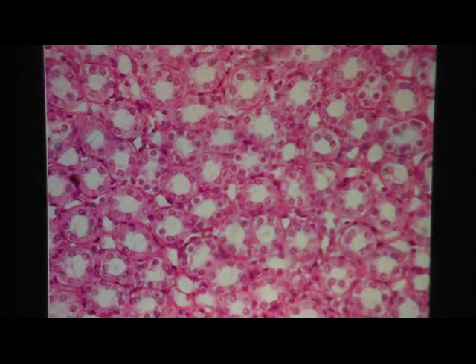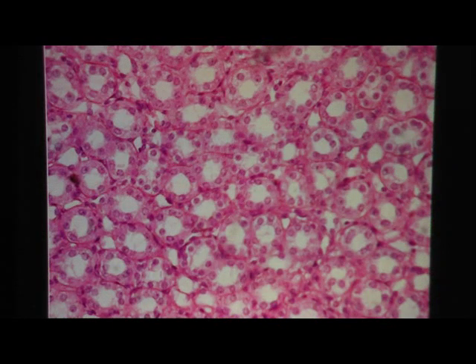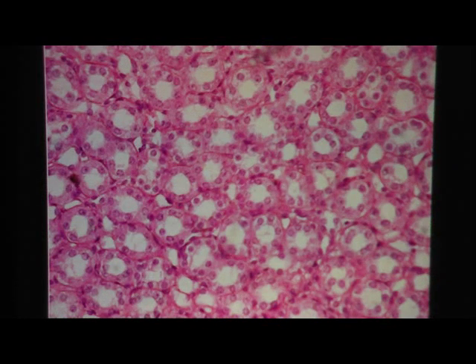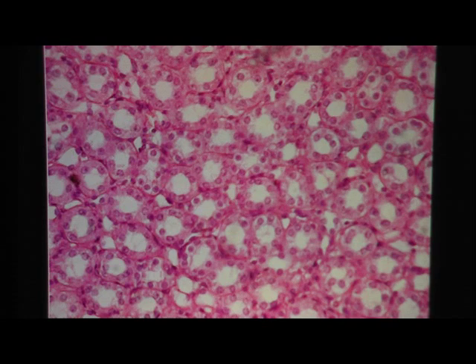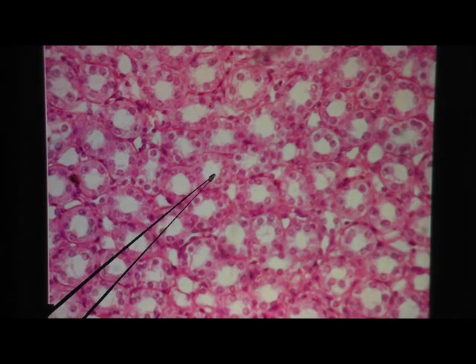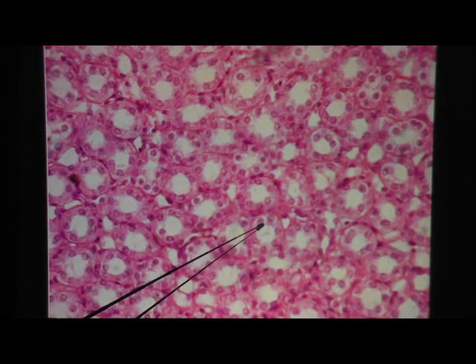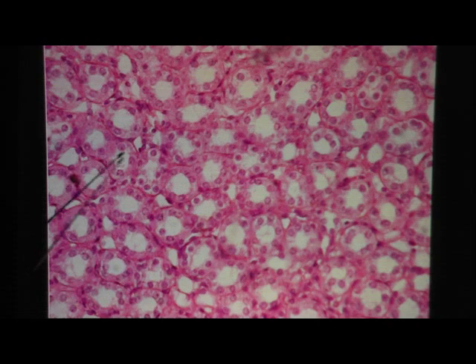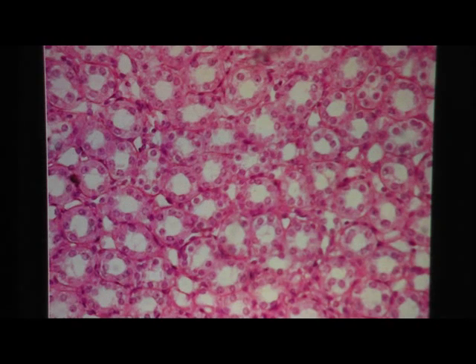Here's another view of simple cuboidal epithelium. This slide is packed with tubes — we're back in the kidney here.